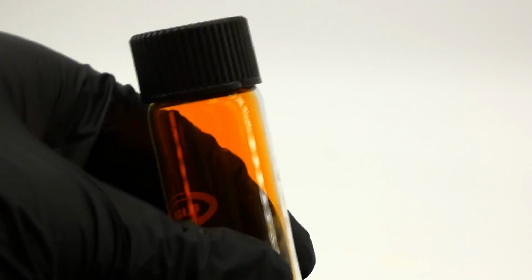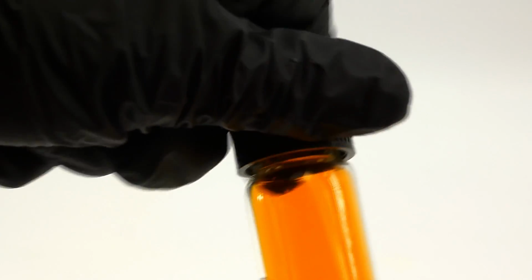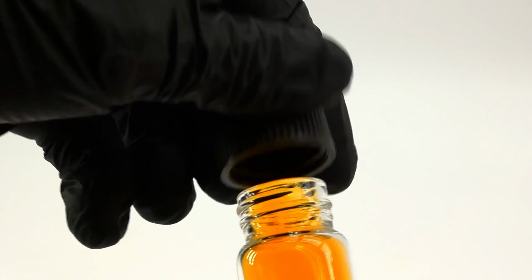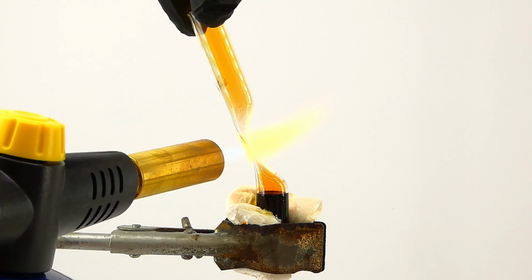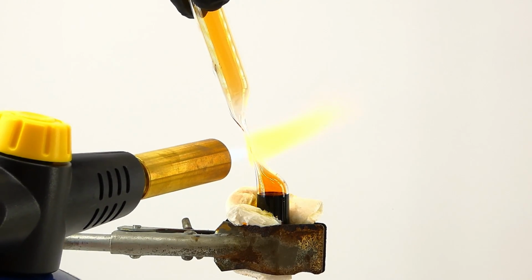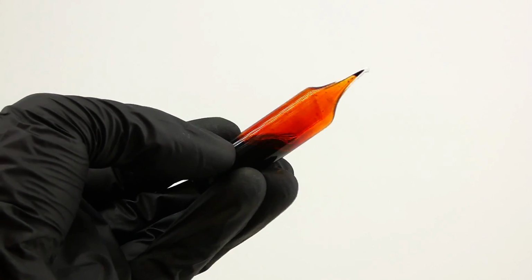After all the experiments, I was still left with about 15 grams of bromine in the vial, and I couldn't store it for long because the bromine already started eating through the plastic cap. It does this to almost every conventional means of storage, so to prevent it from escaping, I sealed it in a glass ampule made from a test tube, which will hopefully allow me to store it for a long time.